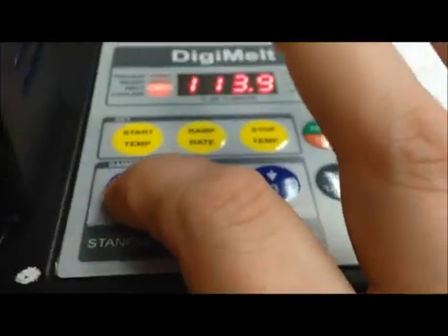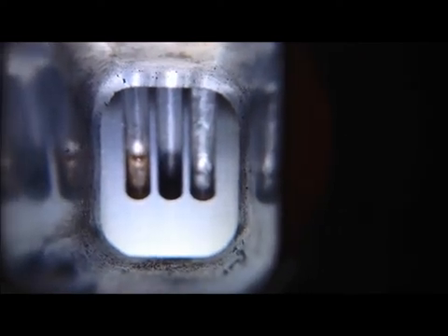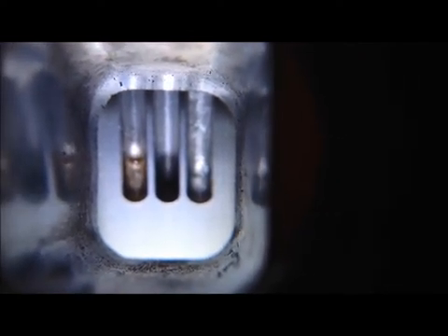The one on the left is starting to go. You can see the color changing at the bottom. So since the one on the left has started, I'm going to hit button number one. That tells me that my start temperature is there. You can kind of see it starting to melt a little bit up at the top. It's getting clearer. The one on the right is holding steady.